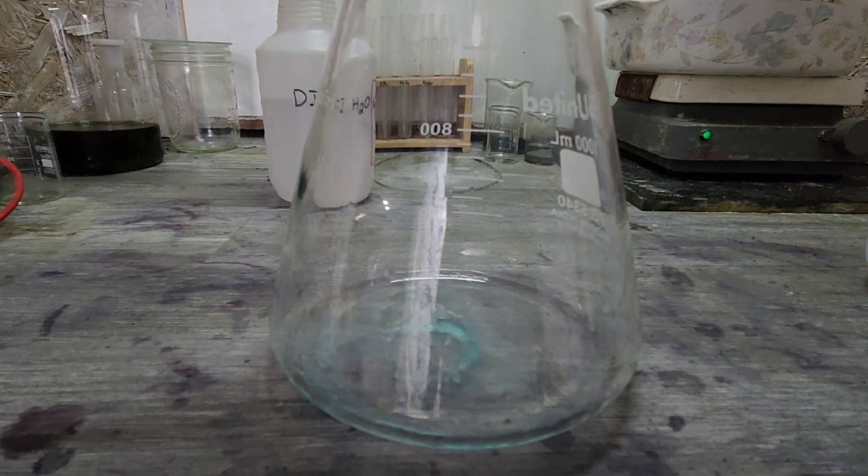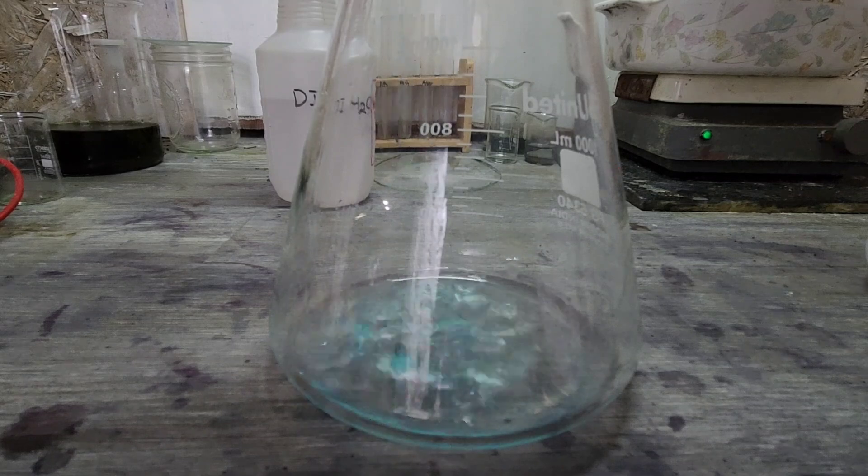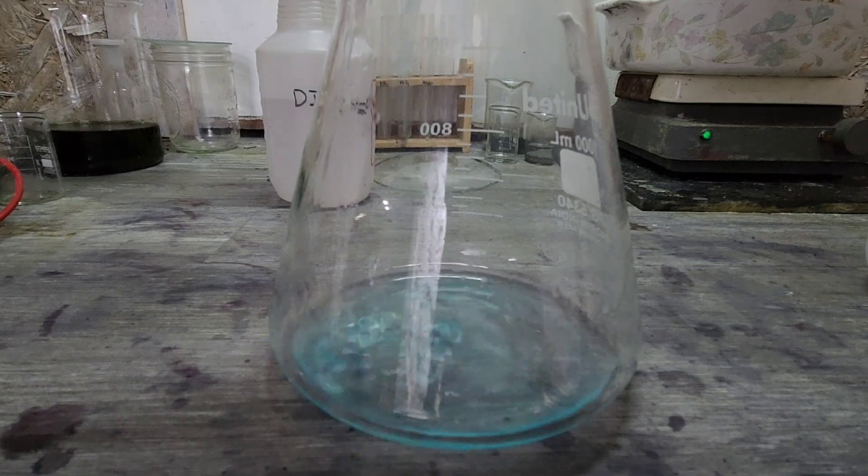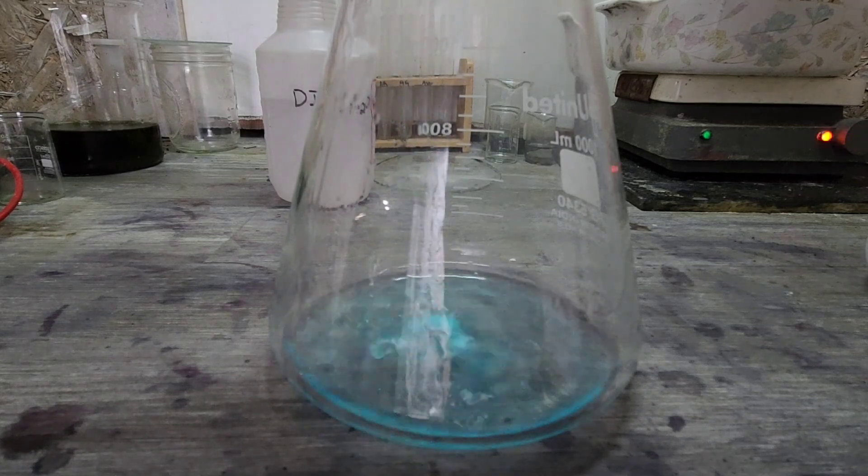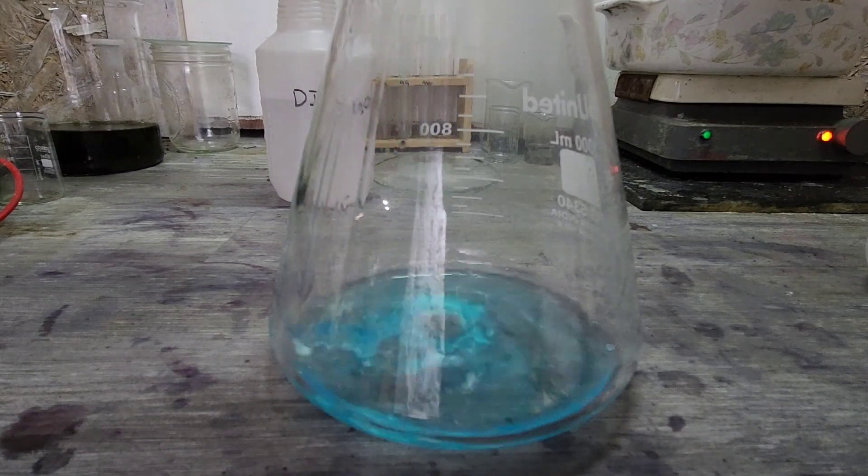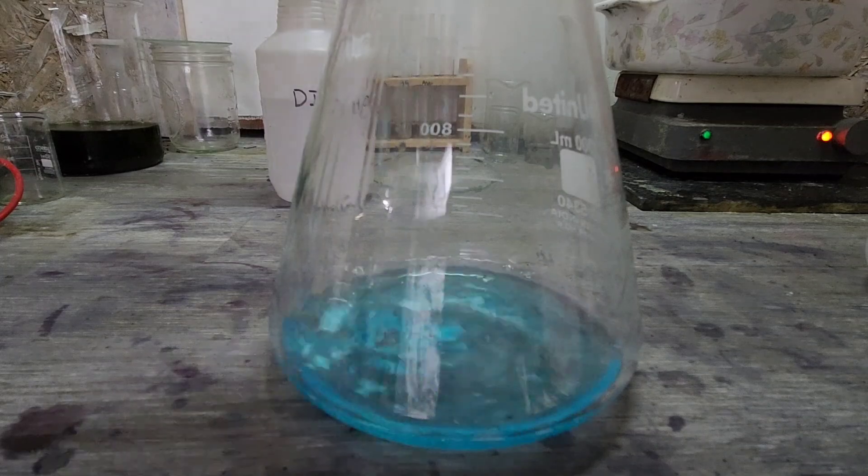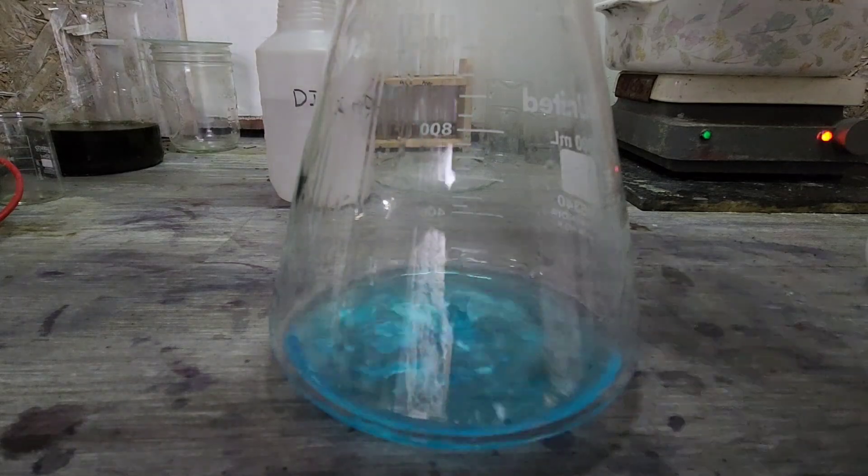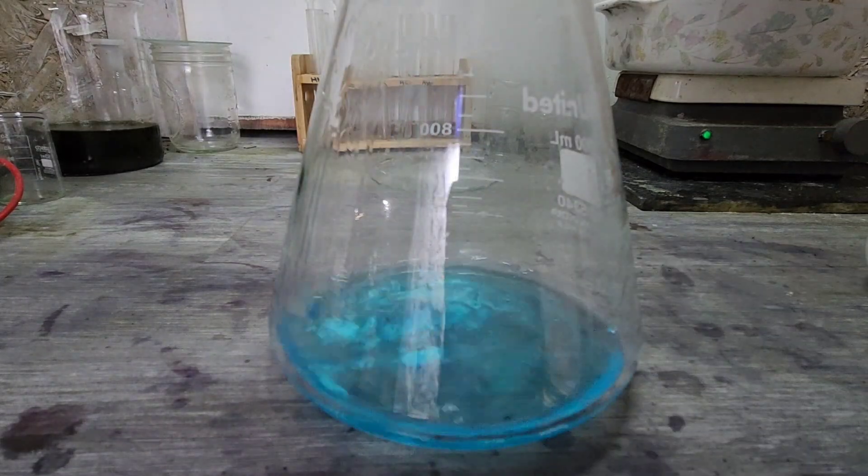Let's get you a close up of it coming out of the filter. So the beaker is easily handable, or hand, yeah, easily touchable. There we go, that's what I'm looking for. So we definitely brought the temperature down.